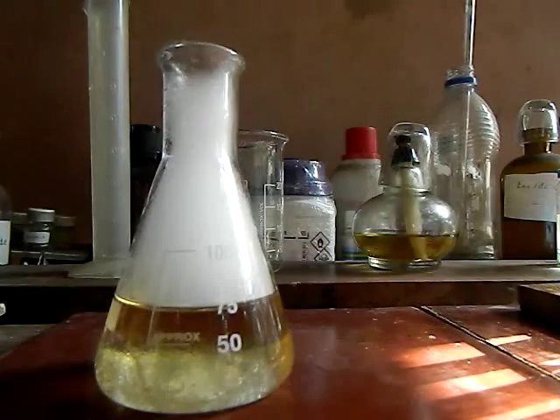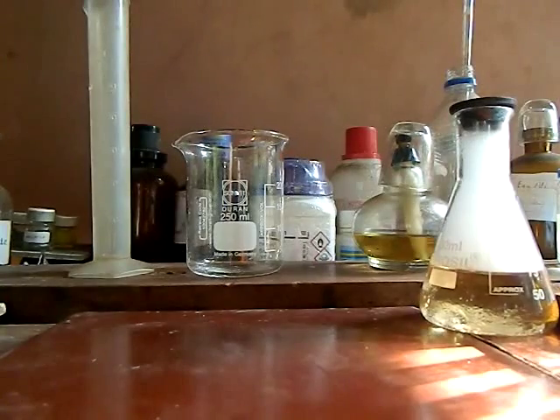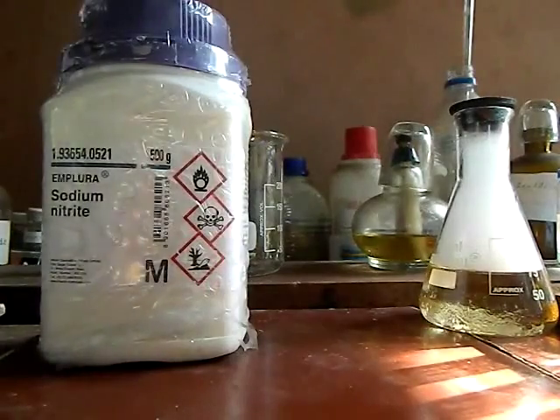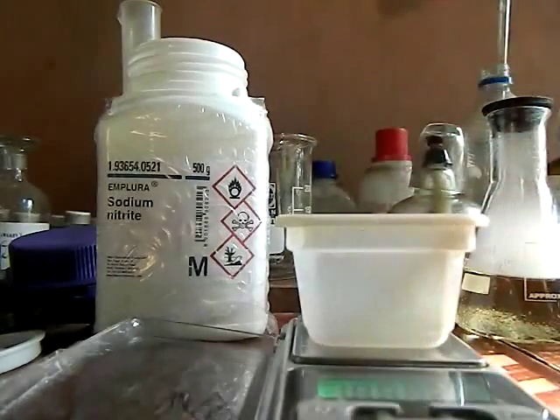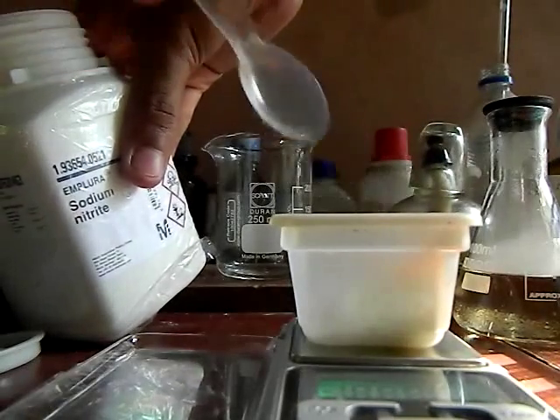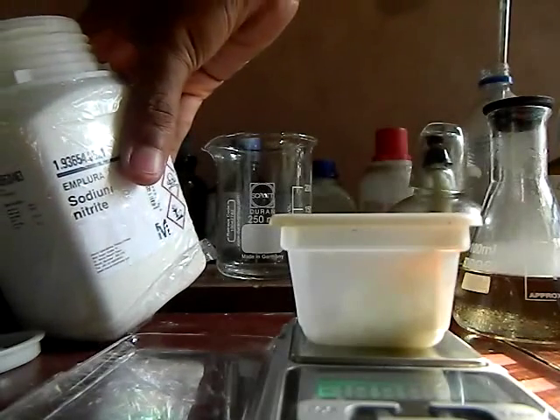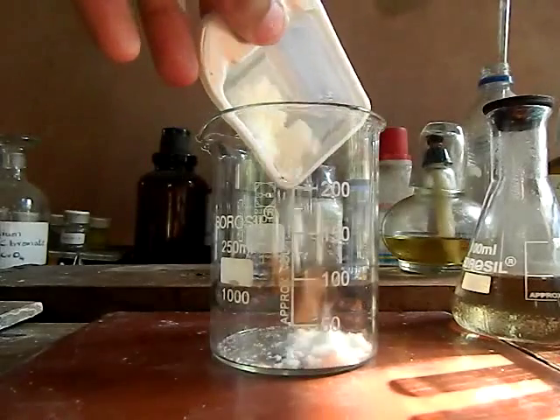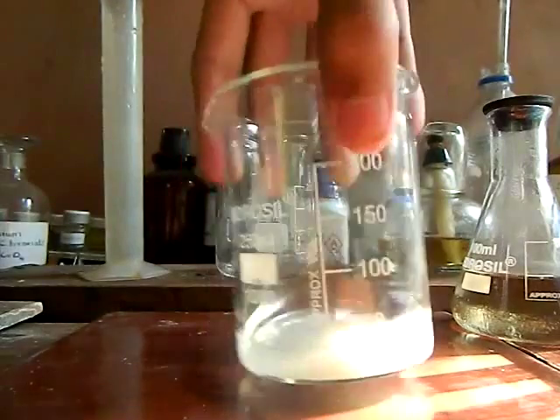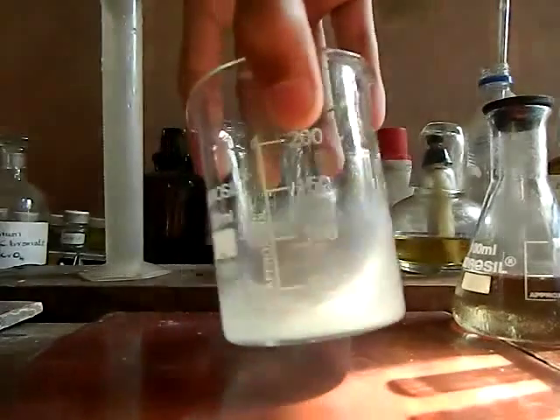You can see a lot of fumes here due to the exothermic nature of the reaction. Now we set that aside and prepare the next chemical. We need sodium nitrite solution — we take about 7 to 8 grams of sodium nitrite, weigh it accurately on a digital balance, add it into a beaker, and pour in 30 ml of water and shake it well.